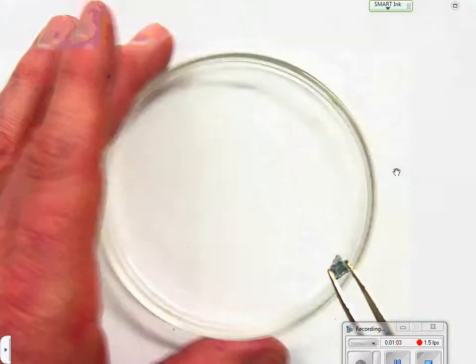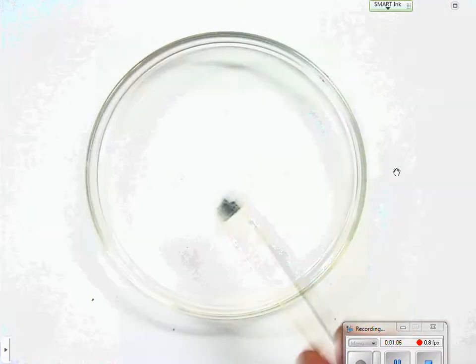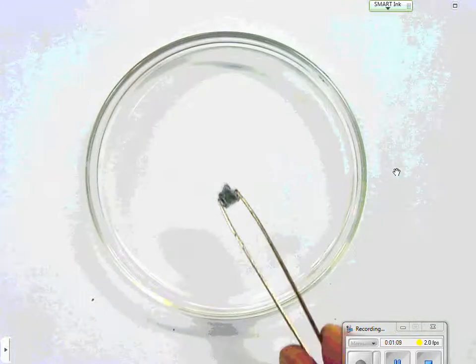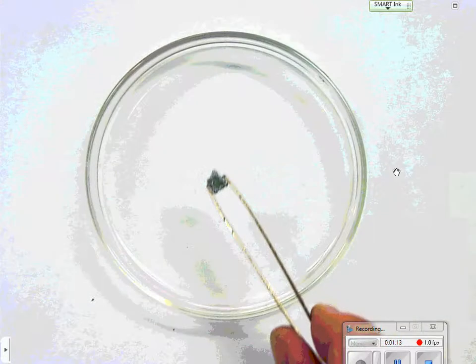And as it reacts, the reaction will go faster and faster. This is what I call a controlled reaction. Not quite as wild as what they were showing. But pretty good. Here you go.